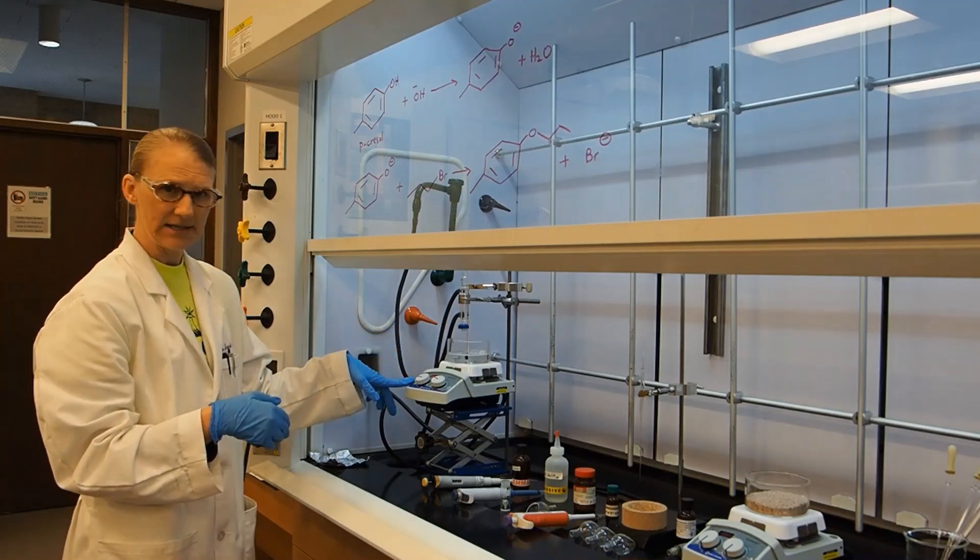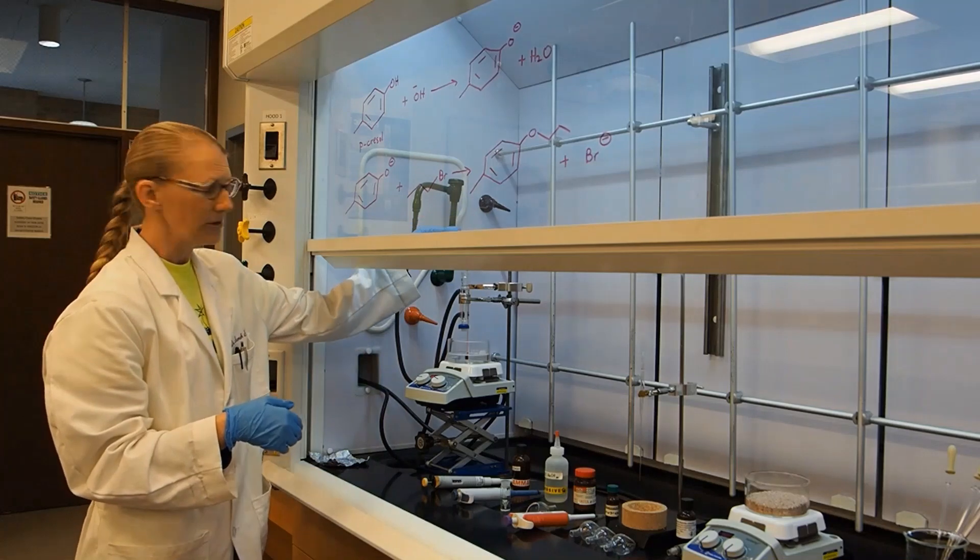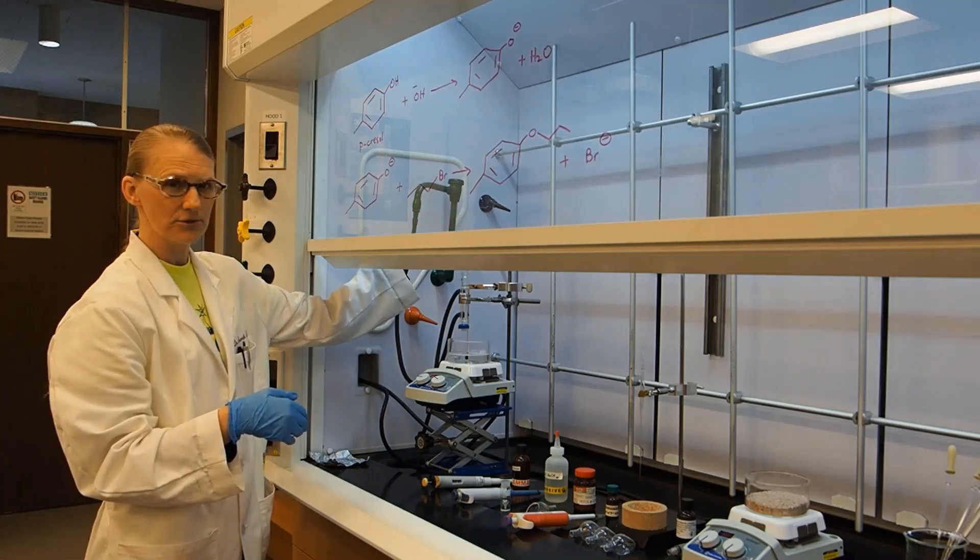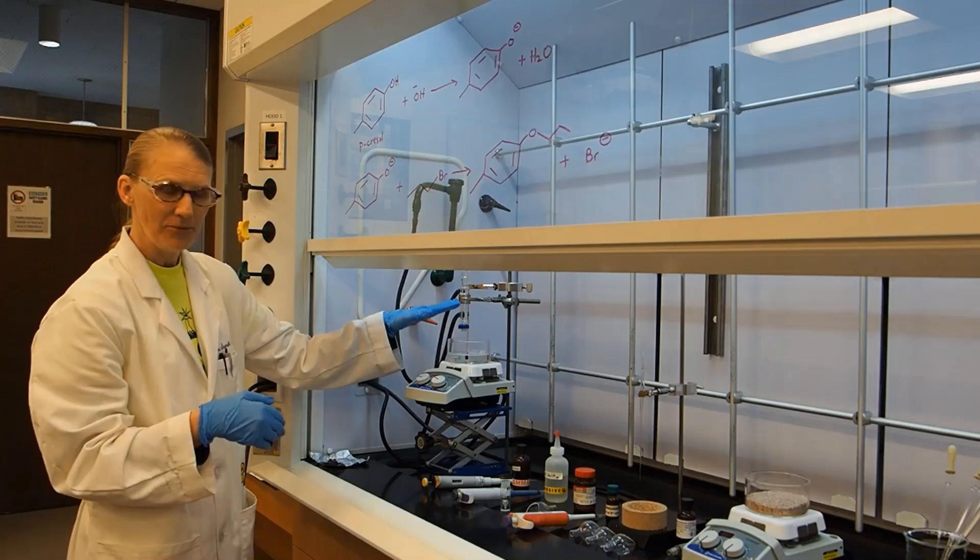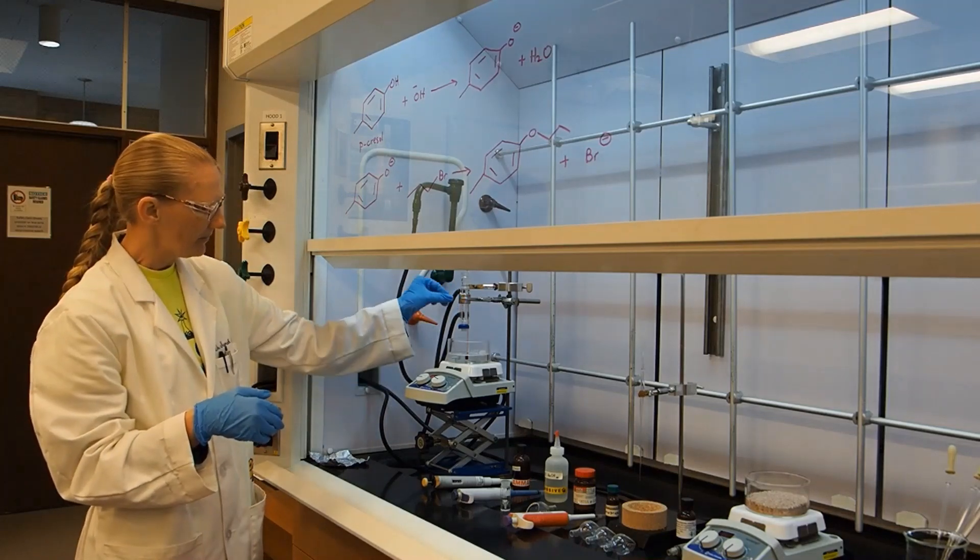The heat is set at 60 degrees. I have a thermometer that goes to 200 degrees held with a thermometer clamp, and I have my condenser clamped above the oil bath.